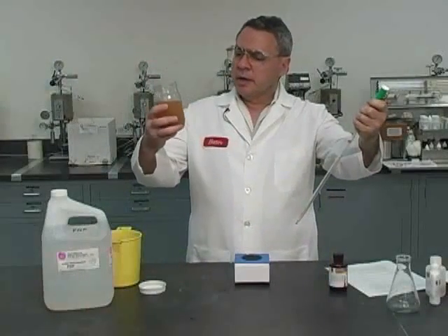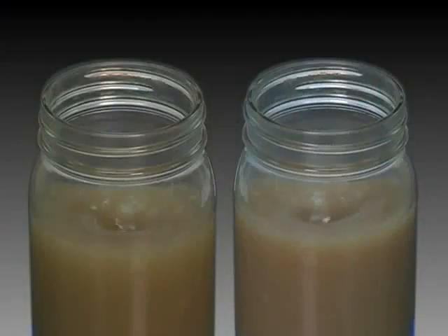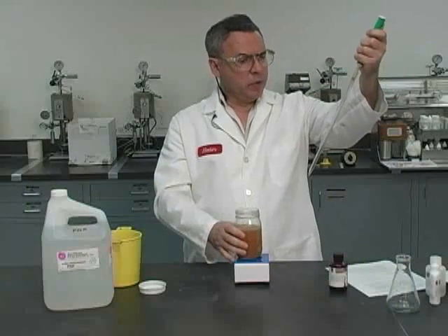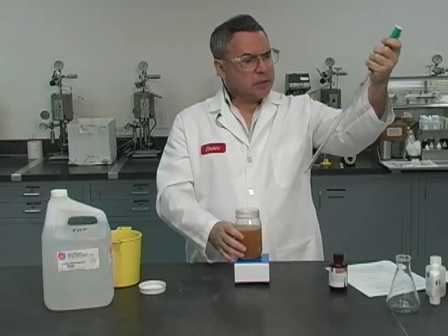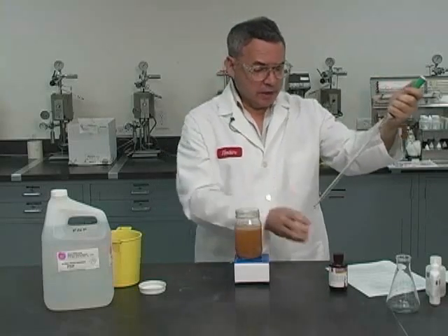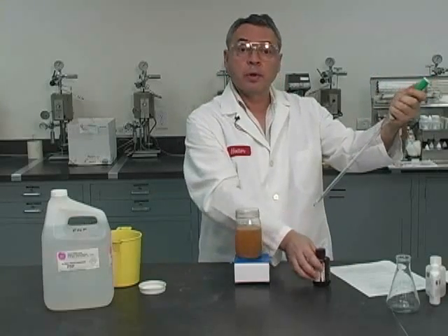Yes, this is clearly the final point. We are not looking for a very strong pink color, but just a certain tone of a pink or a trace of a pink, and this is it. And we got it with 9.4 cc's of silver nitrate, the one which is most concentrated, 0.282 normal.